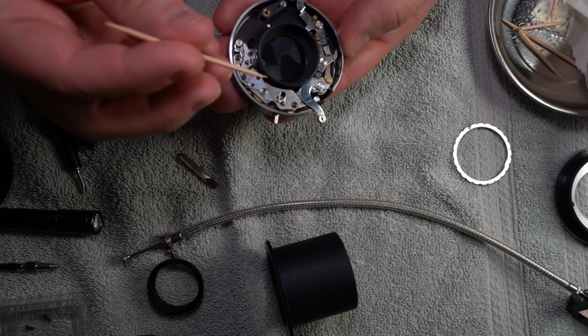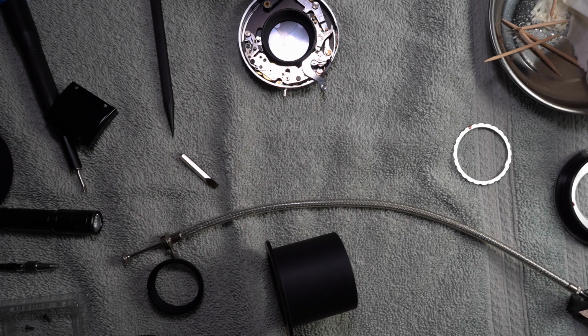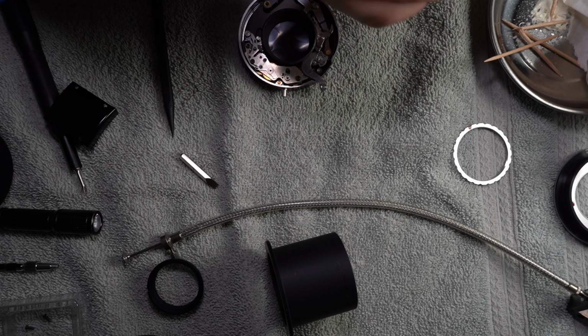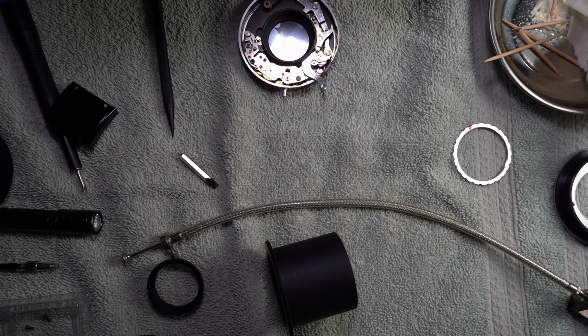I don't know how well you're going to be able to see this, but I'm going to try. And again, a tiny piece of a napkin. And this is like one of the store napkins, so it's cheap. But that's actually good for this. Lens paper would be the best for this, I think, but I'm not going to use lens paper. I actually have it in the box right beside me, but I don't feel like using it right now.